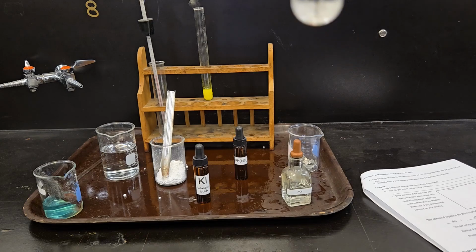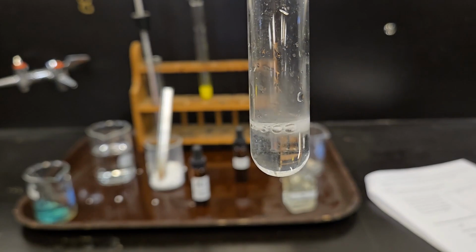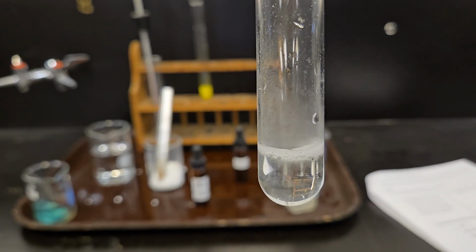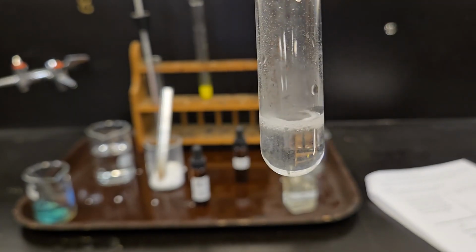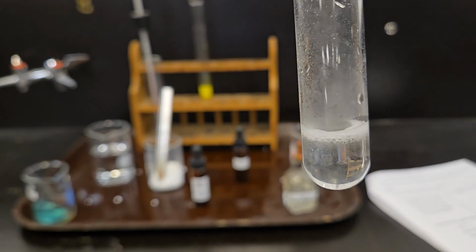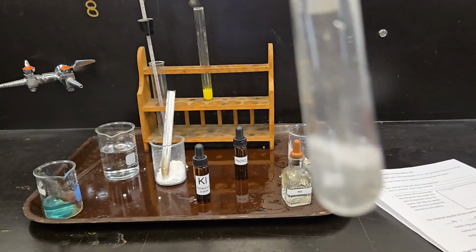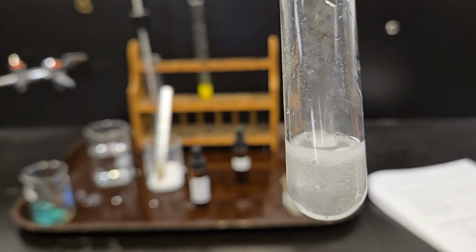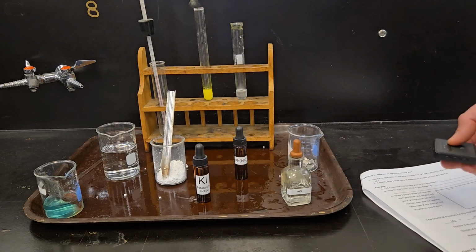And a couple pieces of our magnesium. Going to drop it in right now. There we go. And you can see that reaction taking place immediately. If I hold my microphone right up to it, you can hear it quite well as well. You can see vapor collecting on the side of the jar. You can see bubbles happening right down there. Give it a shake, makes the reaction more aggressive. There we go. That reaction will continue until all of the magnesium is gone.